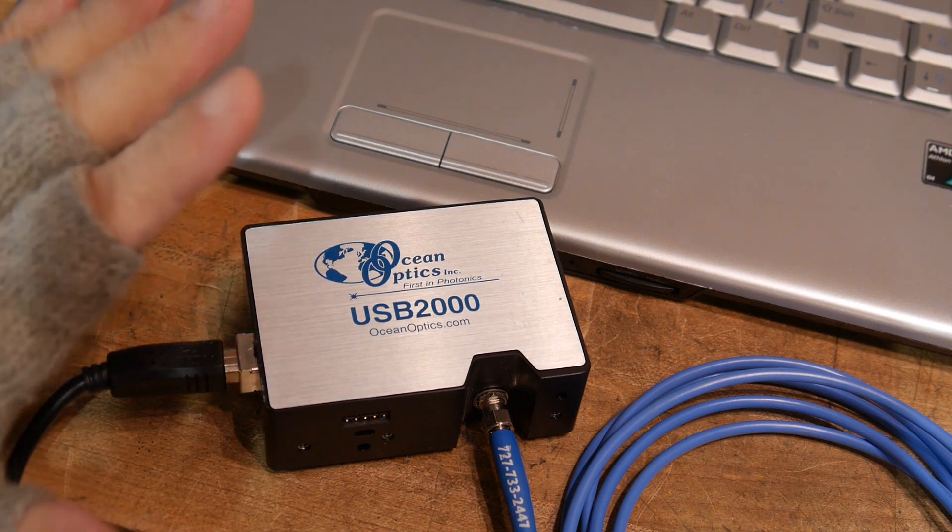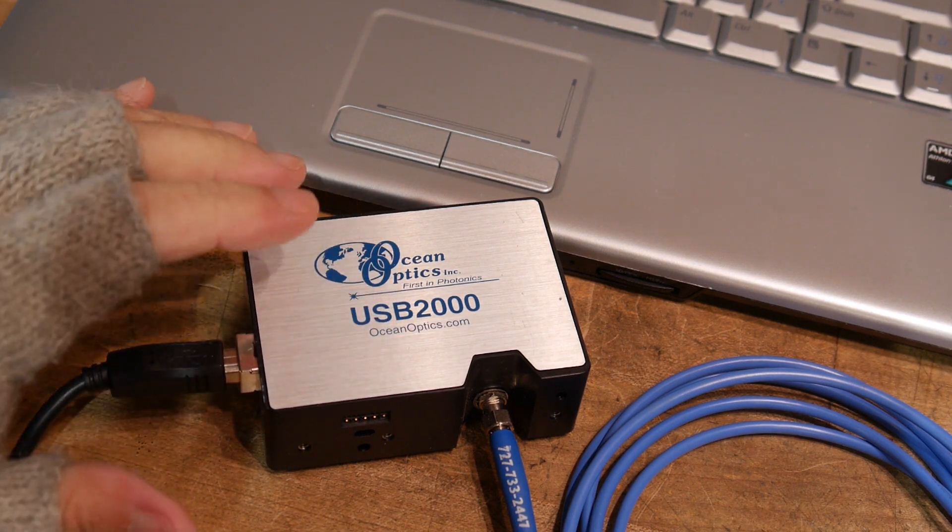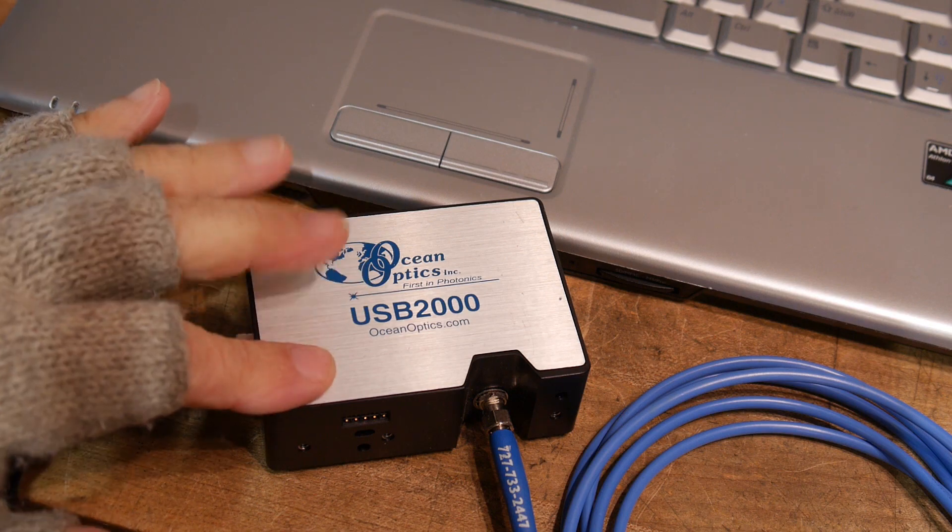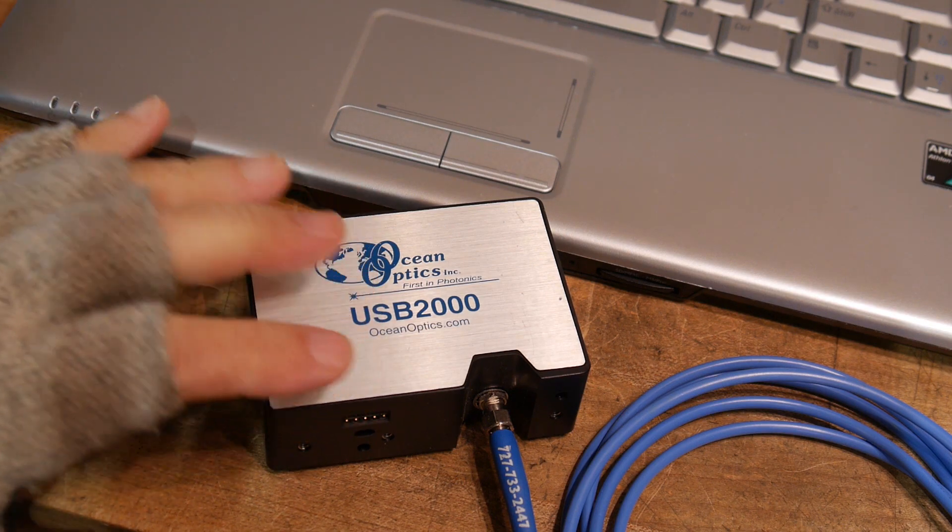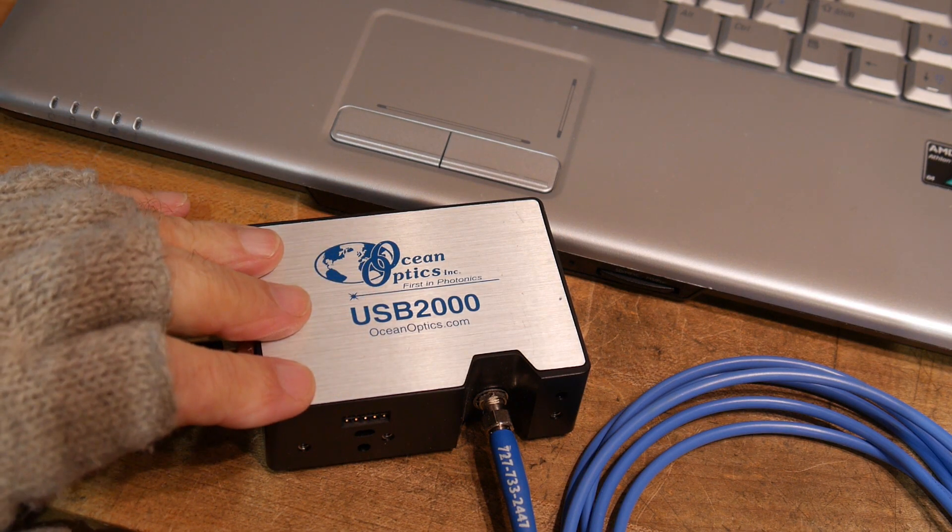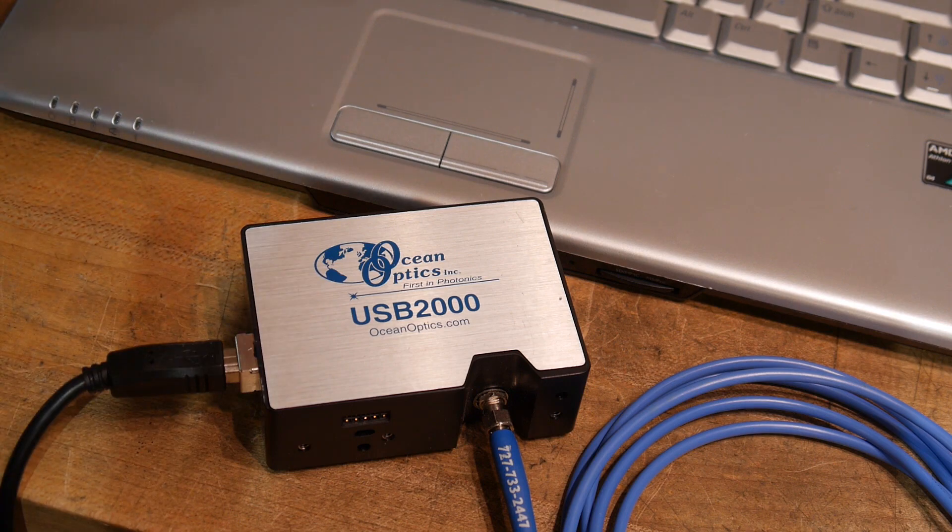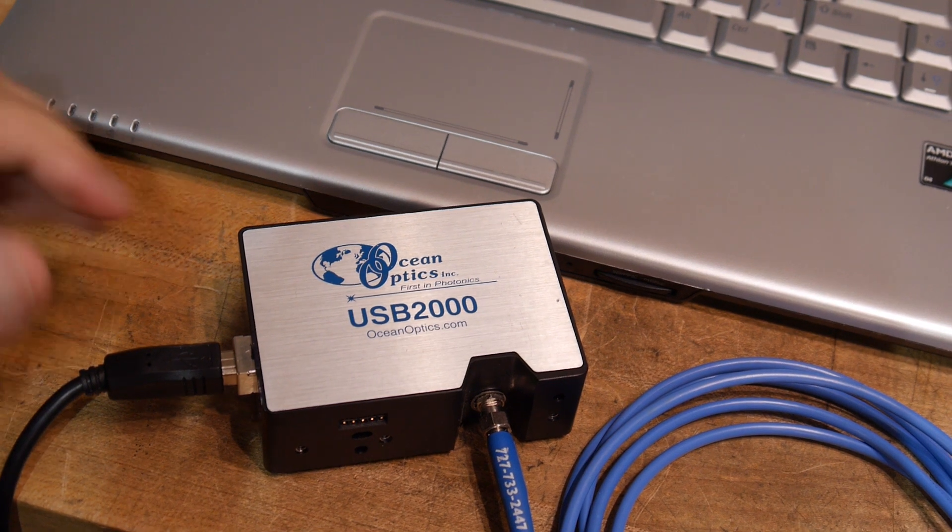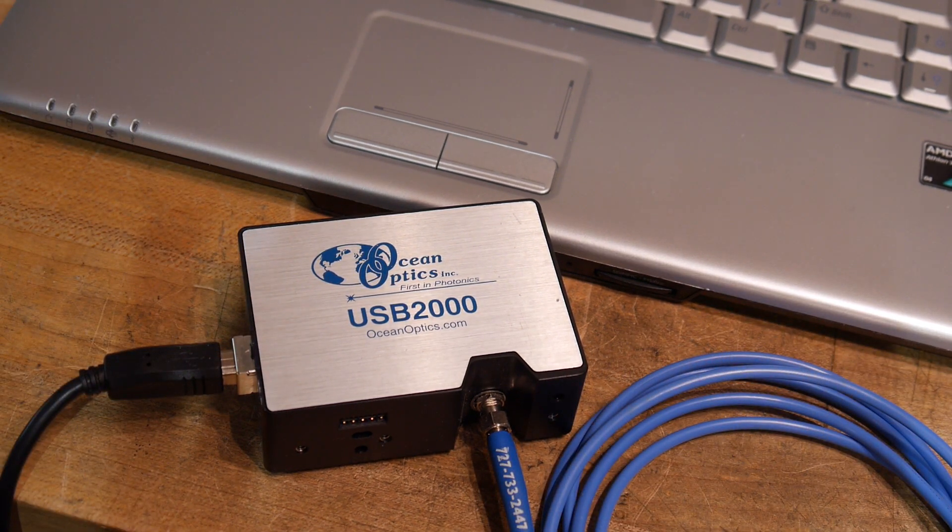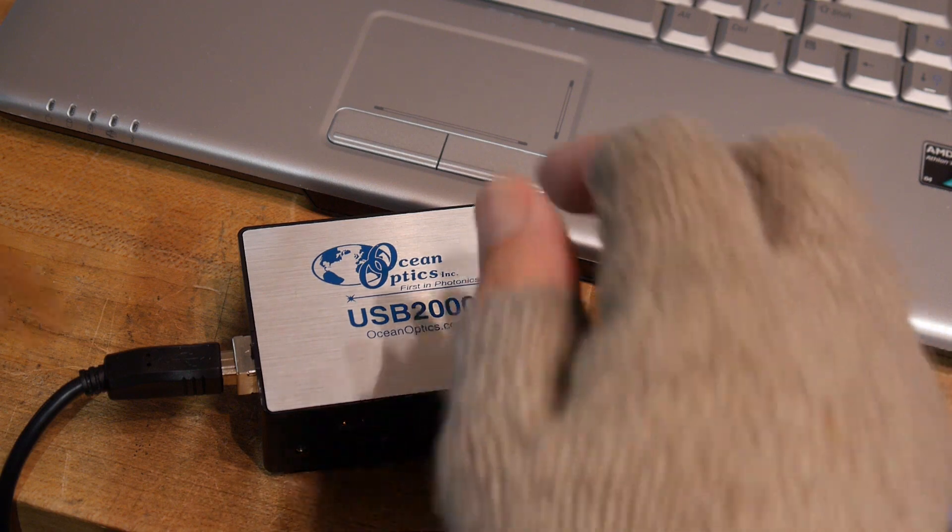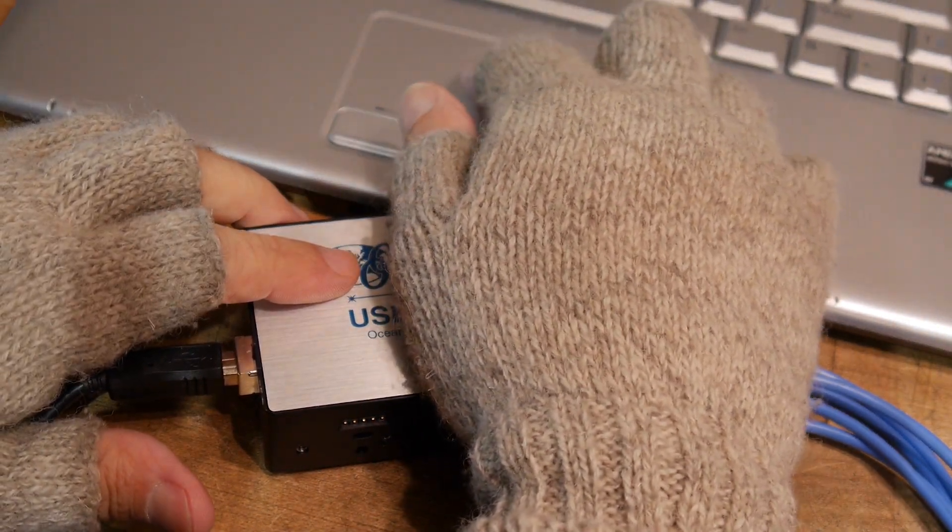So it's a very old machine and it's not compatible with Windows 10 any longer. So I have a computer here that has an old version of Windows.